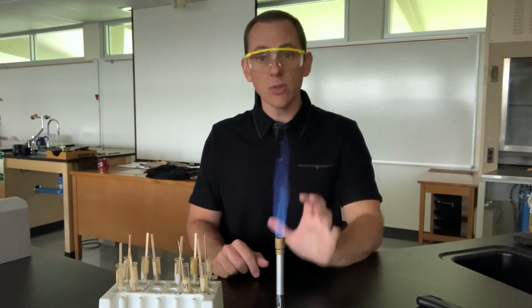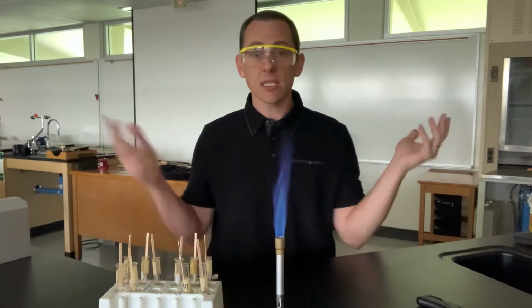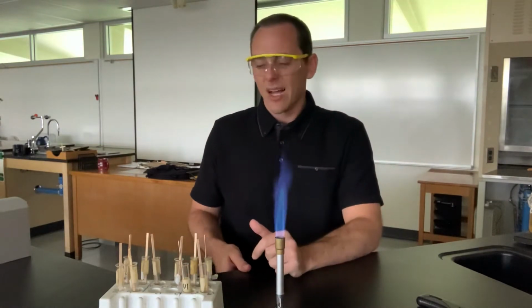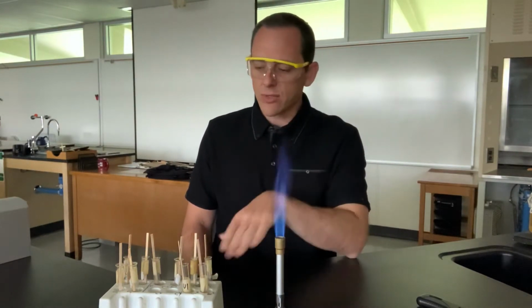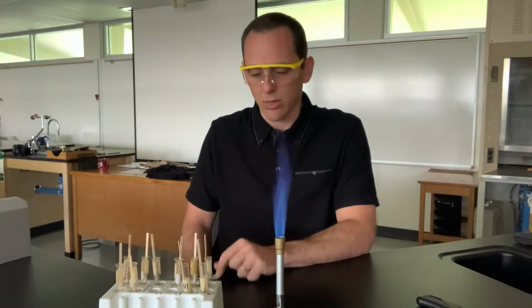And we actually use this technique to identify unknown materials all the time. This is how we know what the sun is made out of. This is how we know what the stars are made out of. And we're going to do the same thing here. Now we could use a spectroscope for this, but it makes it a lot more difficult. And I've chosen elements that all have different colors, and you don't necessarily need the spectroscope for it.